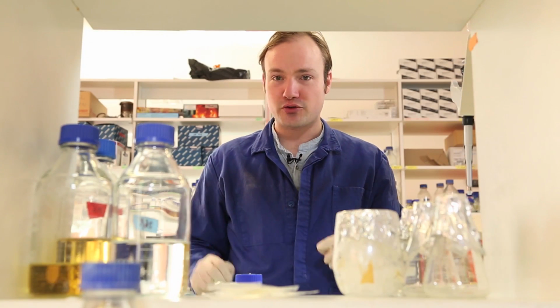The most important thing about preparing competent cells is that once we've resuspended the cells in the calcium chloride solution, we want to keep them always, ever after, at 4 degrees Celsius, because if we allow the temperature to come back up, the cells might start to lyse. Okay, so that's our solutions.